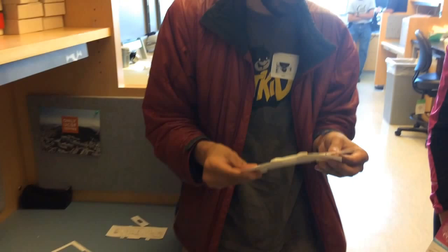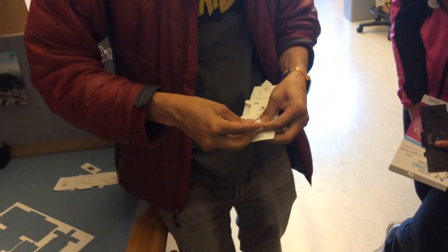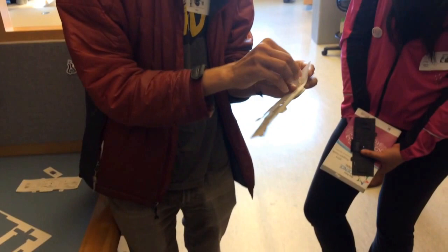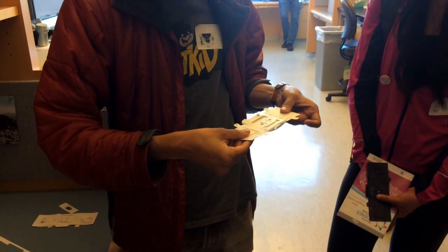So you start seeing some of that shape. Then it's one, two, and three. That mounts the second piece in place. And now this piece couples the bottom and the top together such that I get alignment right there. So at this point, the mechanics is done. We just tuck in these little bunny ears. So if I was not confused, at this point, you have the focusing mechanism, which is that, and then the panning mechanism.